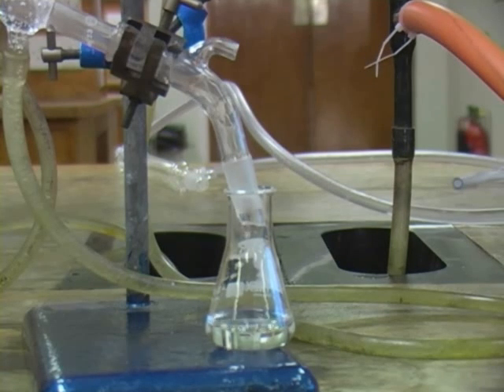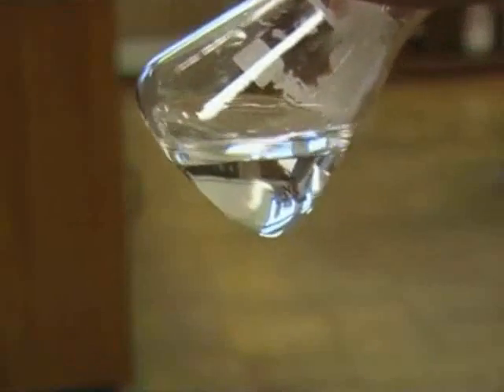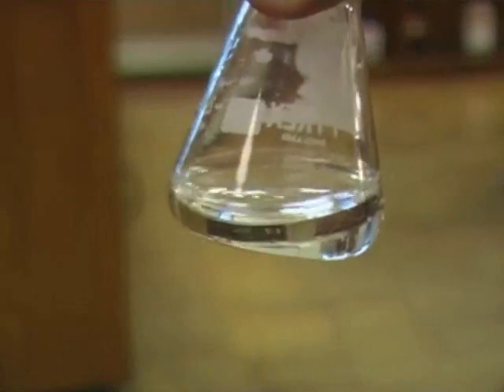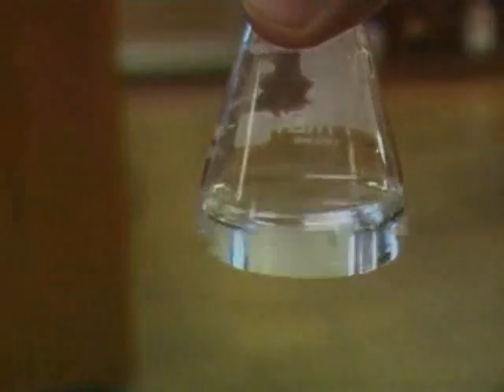Although it may not be visible initially, the oil in the distillate separates from the water forming a layer which floats on top. You will know that the distillation is complete when no more oil is visible in the distillate.